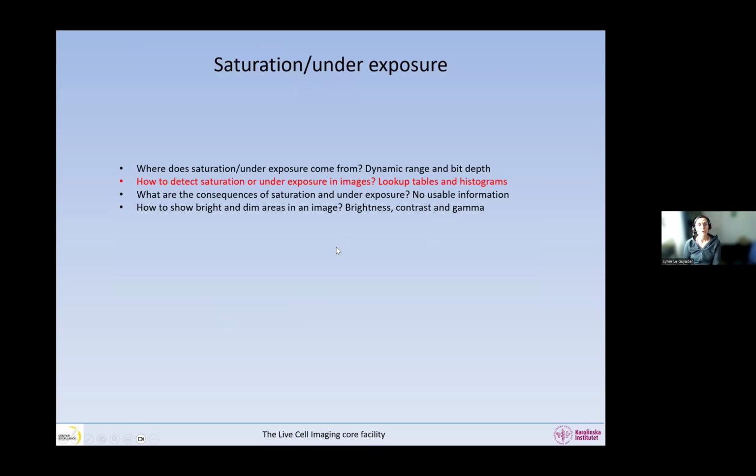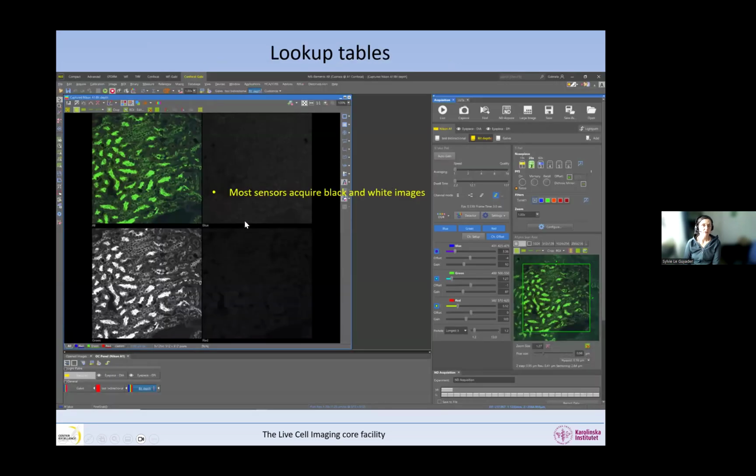So now we're going to talk about how to detect saturation and underexposure. So lookup tables and histograms. So I've shown you already that we have a little button that allows us to see in red the saturated pixels which have the maximum bit depth, and then in blue the pixels that have a 0 bit depth.